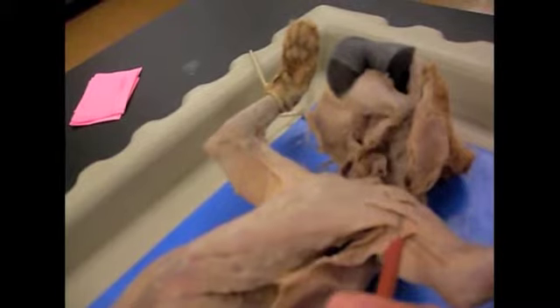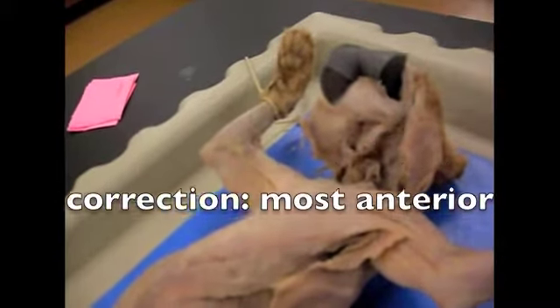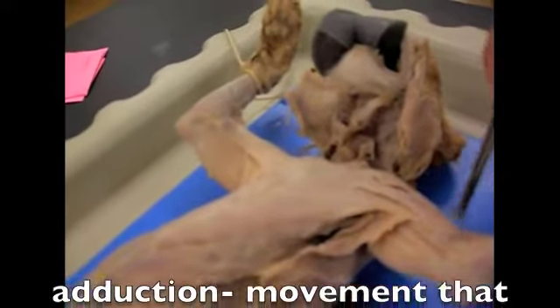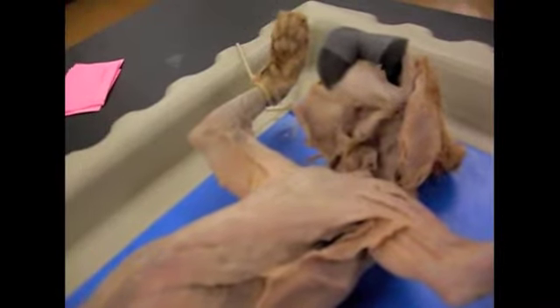Lastly, of these muscles right here, is the pectoantebrachialis, which originates in the manubrium, which is the most anterior part of the sternum, and inserts on the fascia of the ulna, which is near the elbow. All of these muscles function in adduction.